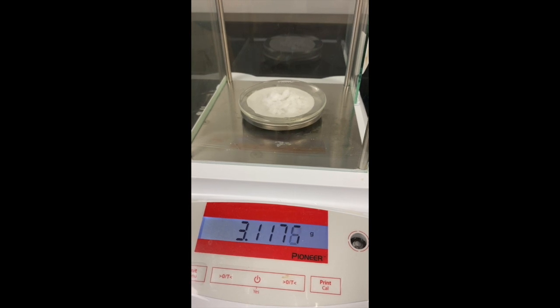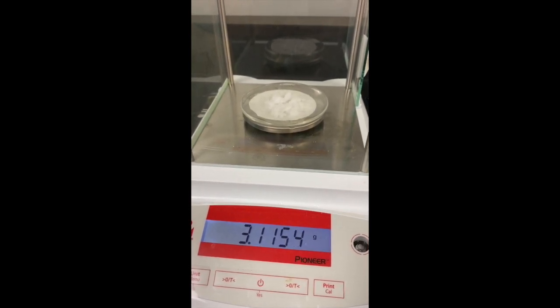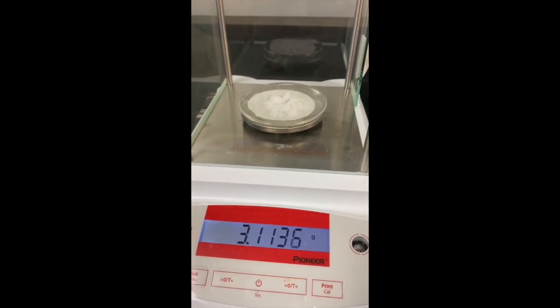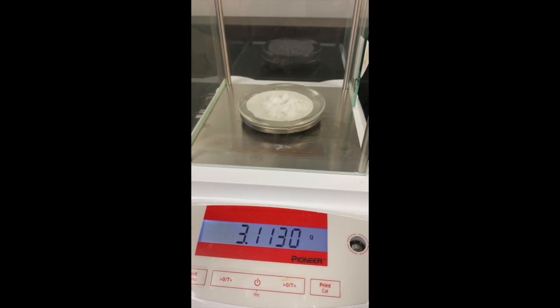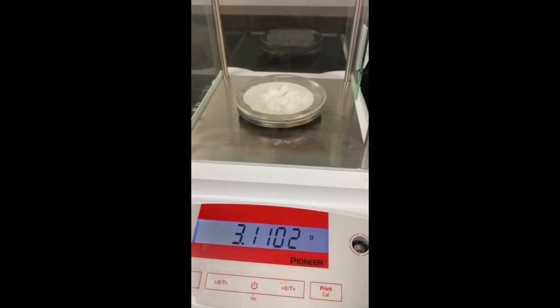All right, here's our crystals. Here's our weight. I did tare out the weight of the watch glass. So you are going to record 3.1140 is fine. And then don't forget to remove the weight of the filter paper to get the actual weight that you recovered.